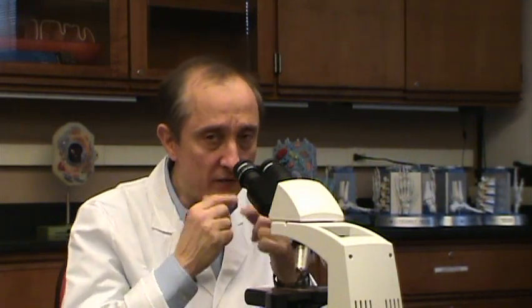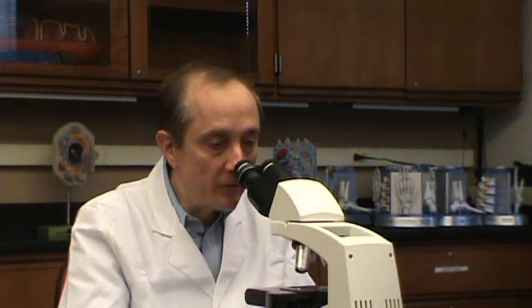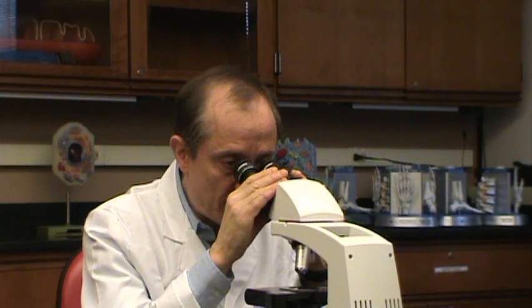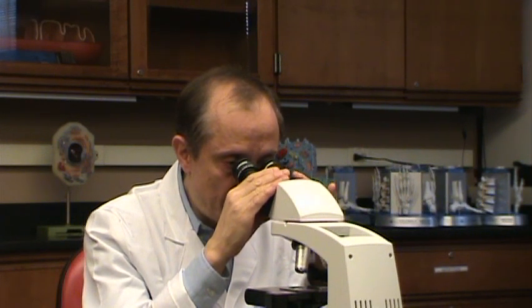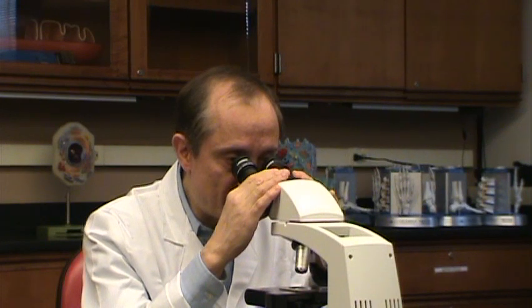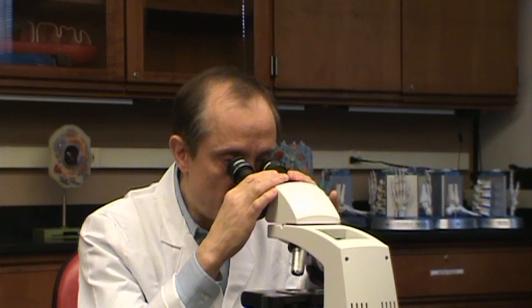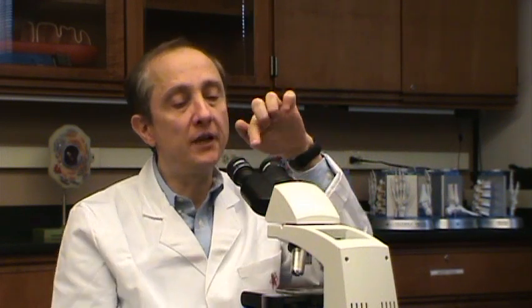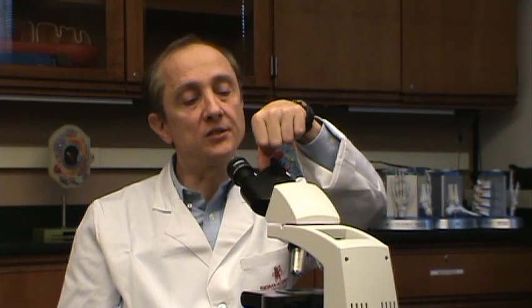Keep that relaxed feeling as you work at the microscope. If you look into the scope and find yourself straining, something is wrong. So I look at a distant wall, let my eyes relax, then put my eyes up to the oculars. I place both hands on the oculars and very slowly bring them apart until I'm seeing one image. Then I can check the pupillary distance — in my case it's about 66 — and in the future I can go right to 66 on any scope.